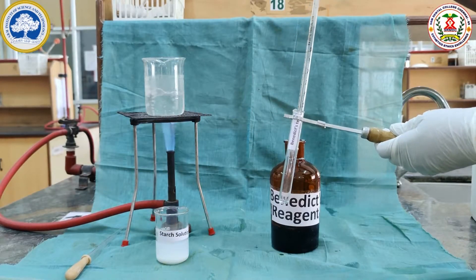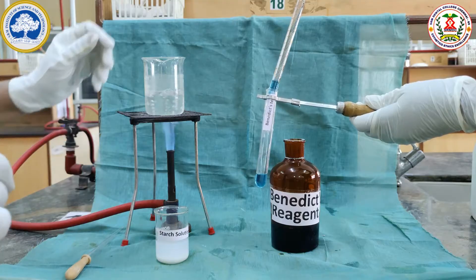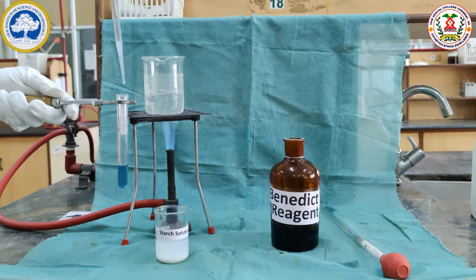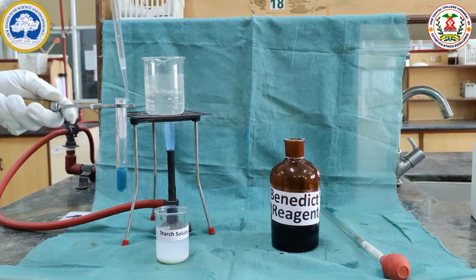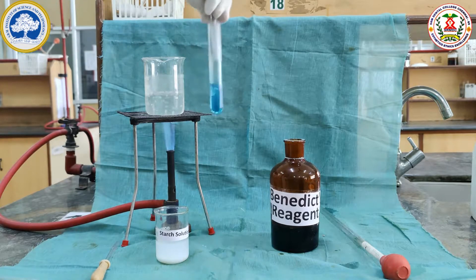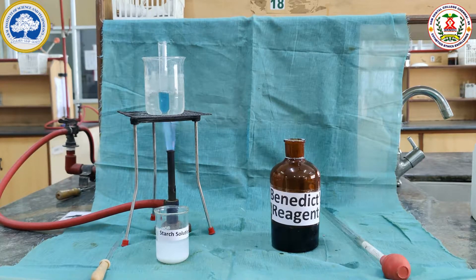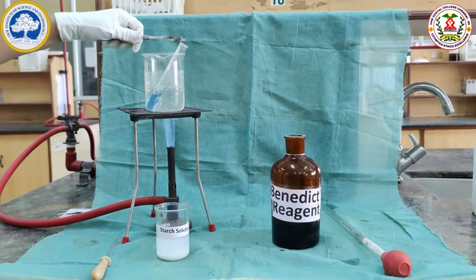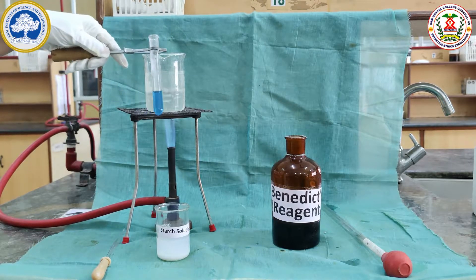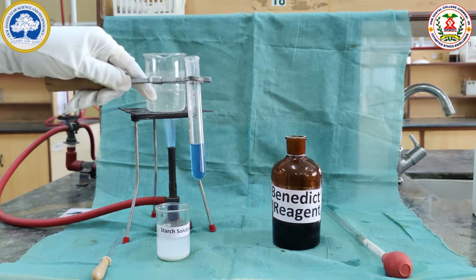Benedict's test is a test to identify reducing sugar. For Benedict's test, we take 3ml of Benedict's reagent and 5 drops of the starch solution, and keep it in the boiling water bath for 2 minutes. The solution is blue in colour. Since starch is a non-reducing carbohydrate, the blue colour persists. After 2 minutes, we can see there is no colour change — the blue colour remains the same, indicating starch is a non-reducing carbohydrate.